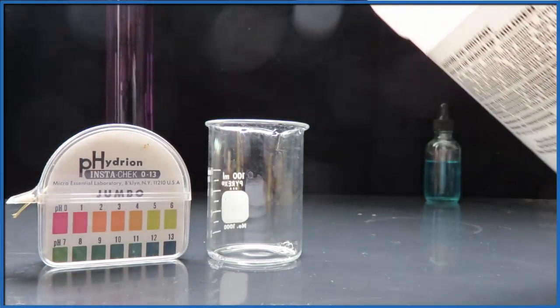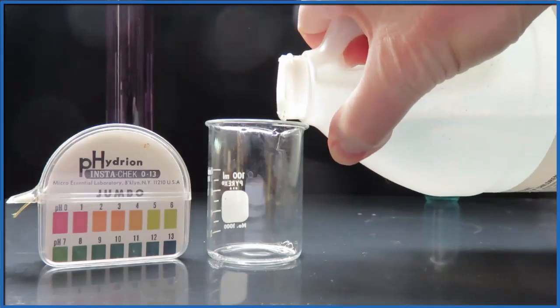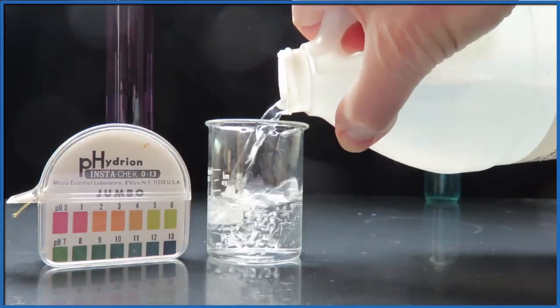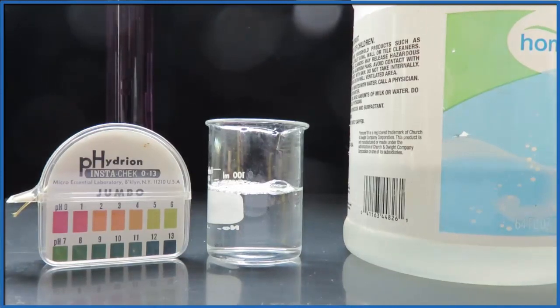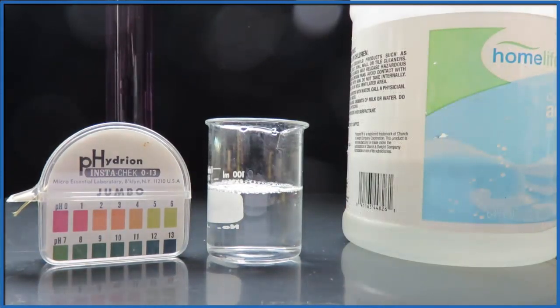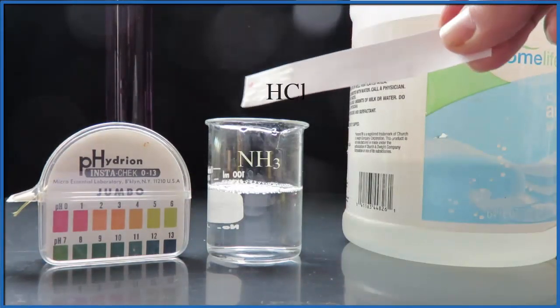If you've ever smelled ammonia household ammonia, it has this really strong pungent smell, but the question is what is the pH of ammonia? So if we take some of this ammonia solution and we put a piece of paper that's been dipped in hydrochloric acid over it.